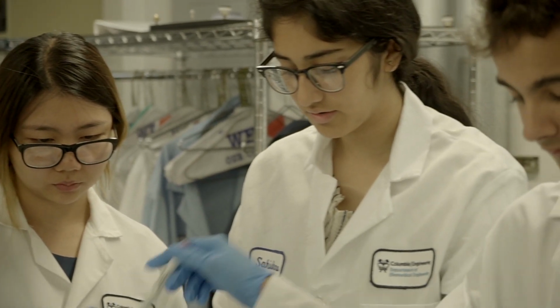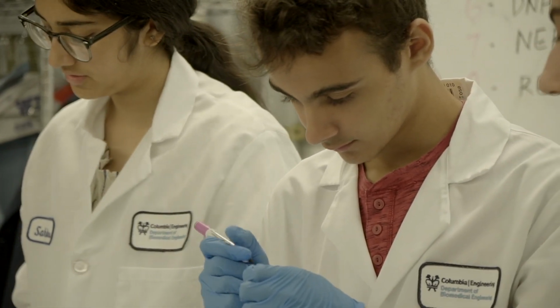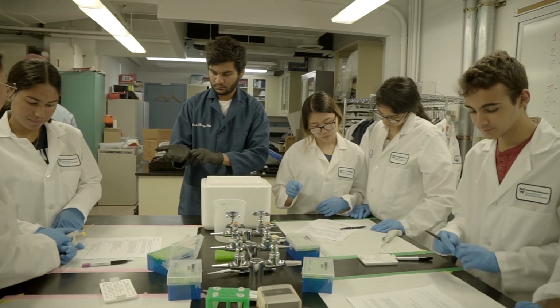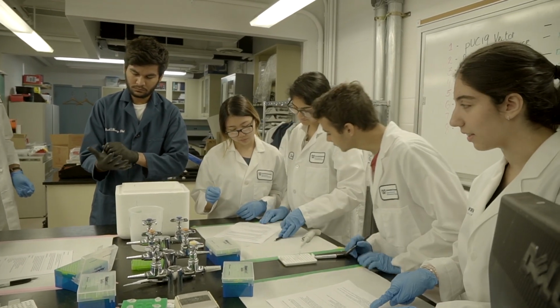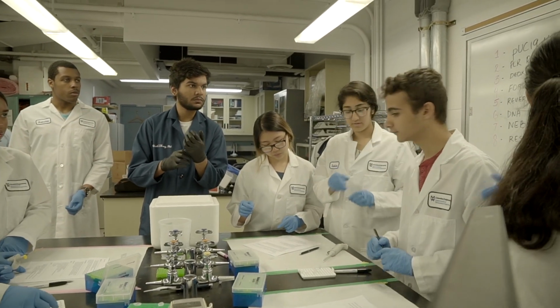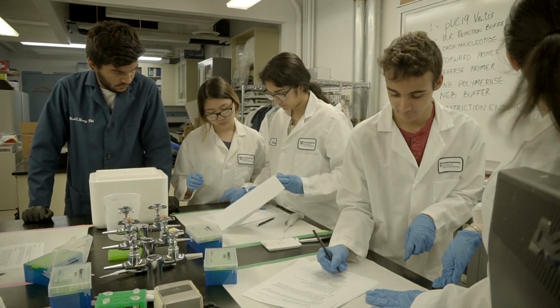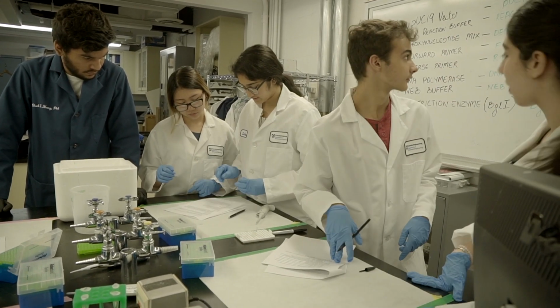So then the next time, hopefully I can run through it by myself without my friend. Do they need this? Oh, you're not supposed to. So the things that they've already done are calculations, and I just confirmed on the board.